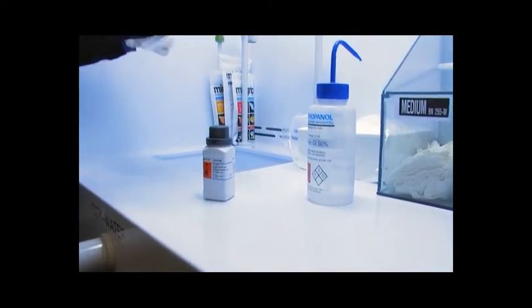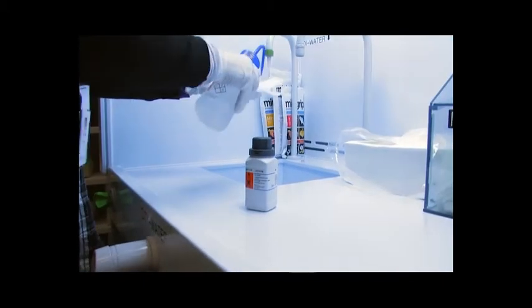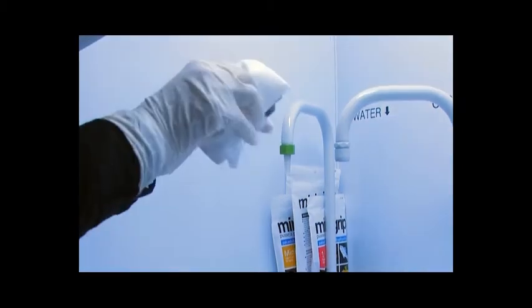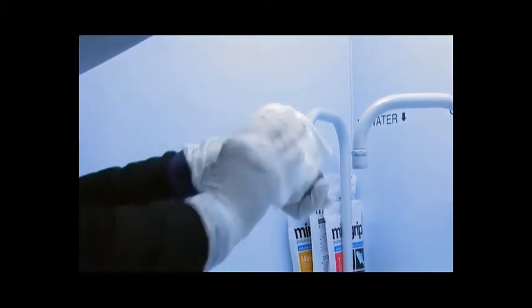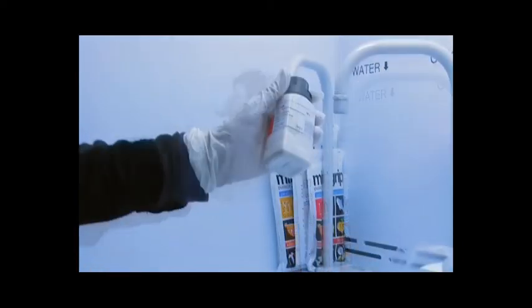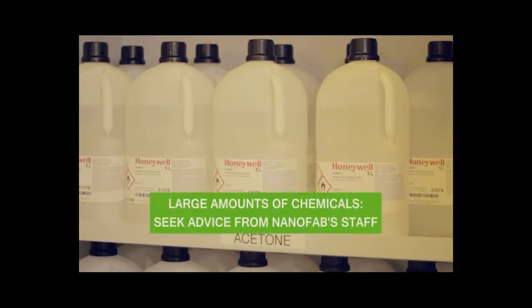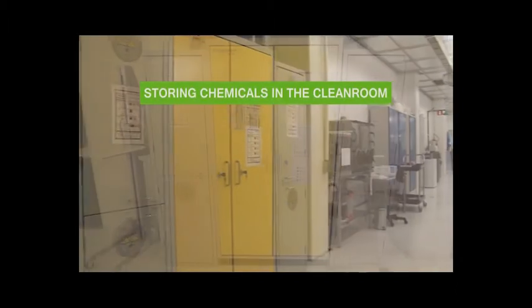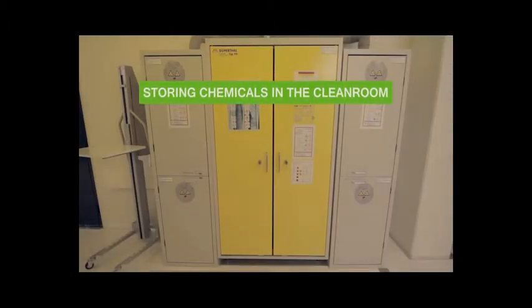You are allowed to bring a small chemical bottle into the cleanroom in the same way as your sample box via the dressing room. Wipe the bottle thoroughly with 50% isopropyl alcohol in the fume hood in the first airlock. Do not forget to use nitrile gloves while cleaning the bottle and transferring the cleaned bottle to the next airlock. In case of larger amounts of chemicals, please seek advice from the Nanofab staff. The buffer stock for the basic chemicals is kept in the special storage cabinets located in the service corridors.